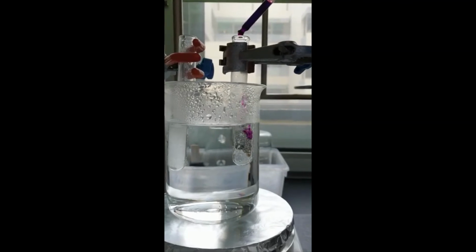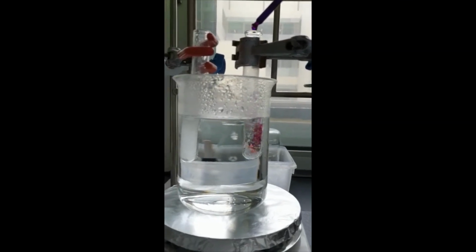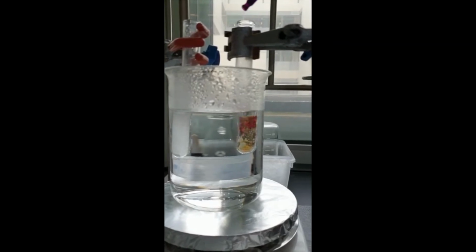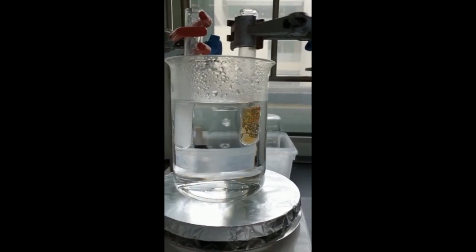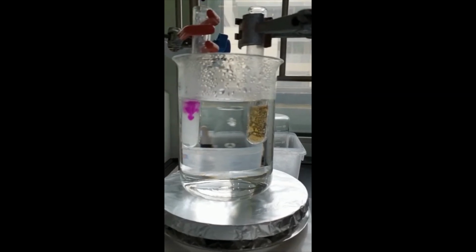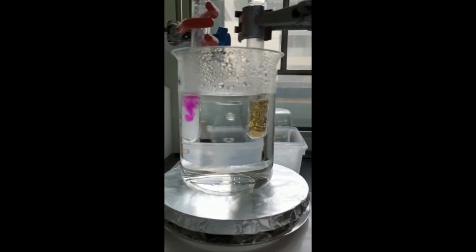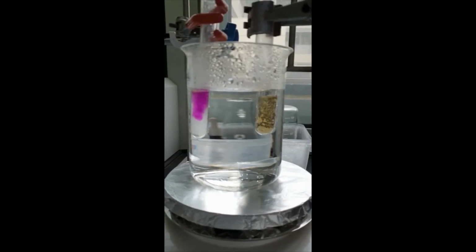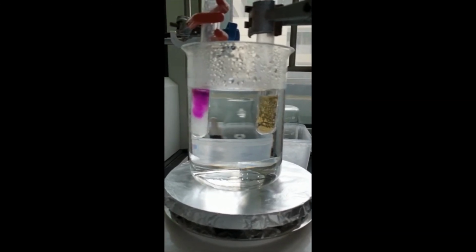Here, Jonathan adds 2 to 3 drops of purple acidified KMnO4 to each test tube. The solution changes from purple to light brown in B, while it remains purple in D. This proves that D cannot be oxidized, and thus we conclude it must be the one with a tertiary alcohol. So D is loperamide. This means B is ambroxol.